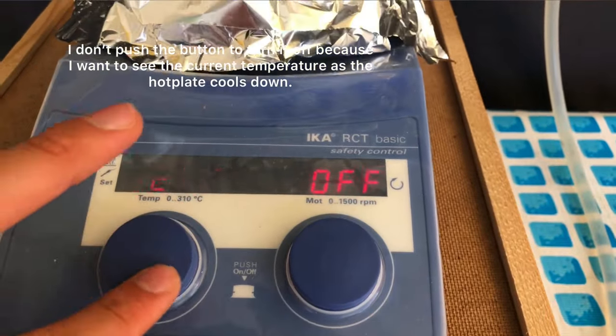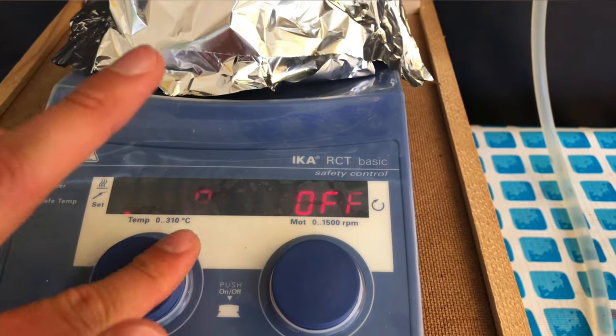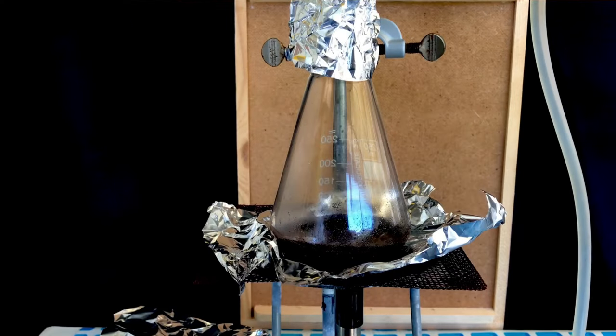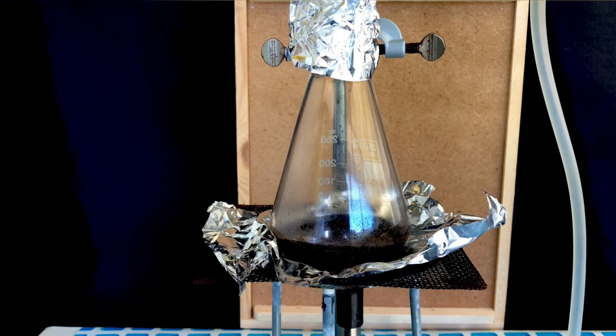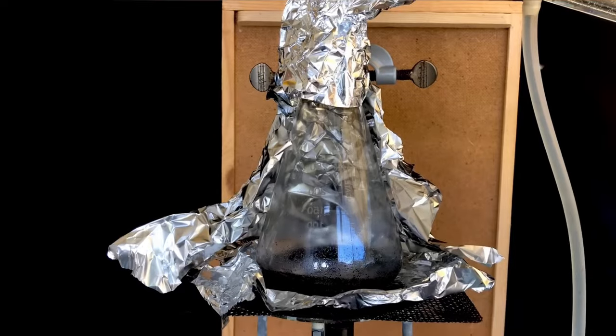Trust me, I heated it long enough, so I turned off the hot plate again, and we switched it out for a Bunsen burner. We lit it up using a handheld torch, and then we just had to wait for the liquid to start boiling, which didn't take too long.